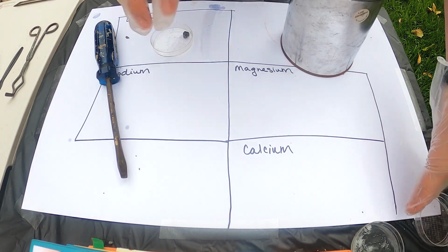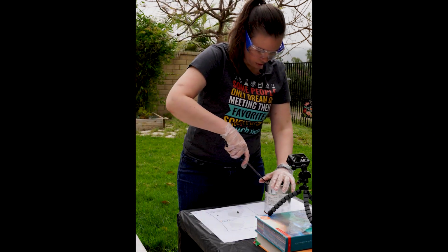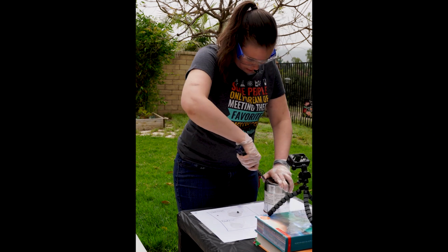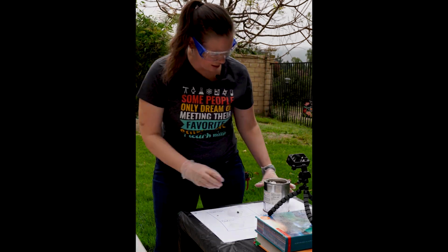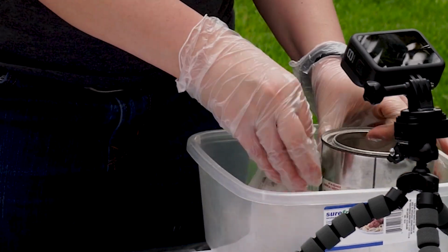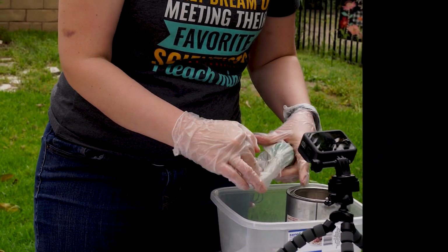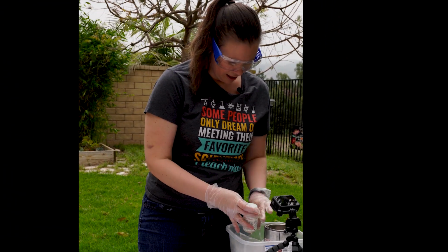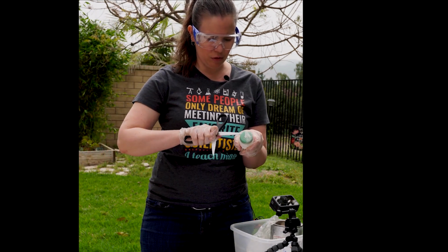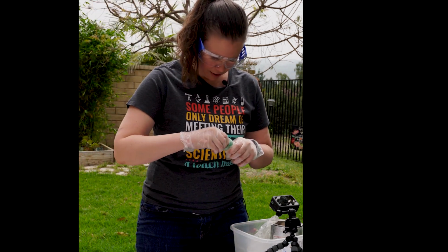Now on to sodium. So sodium again is stored in a big old paint can. So we need our screwdriver to open up this part of the storage. Again, stored in rocks. So I'm going to grab my bucket and pull out the bag. Bag stored with a twisty tie. And then inside the bag, I have the reagent bottle. We have parafilm around the outside to keep it nice and airtight. So that's what we're going to have to remove next. One way or another. There we go.